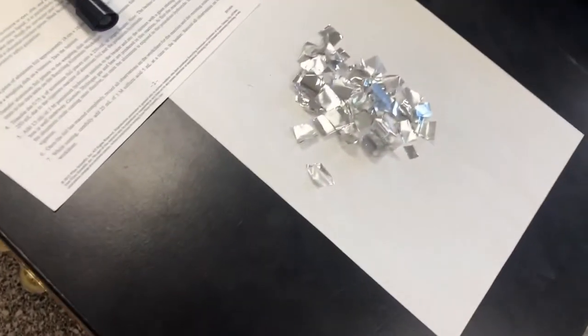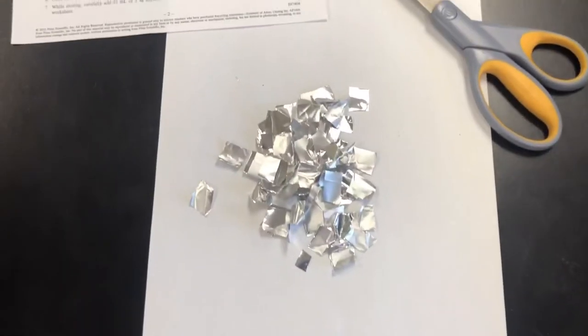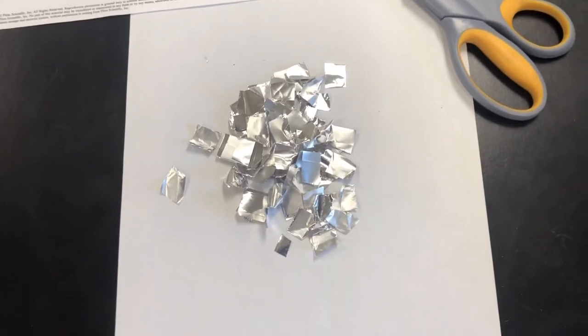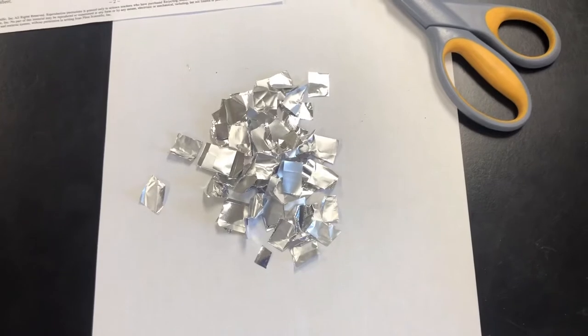What we're going to be doing is taking some simple aluminum, reacting it with some other reactants, namely potassium hydroxide, a strong base, and then with sulfuric acid, a strong acid, and then we're going to try to turn this into alum.